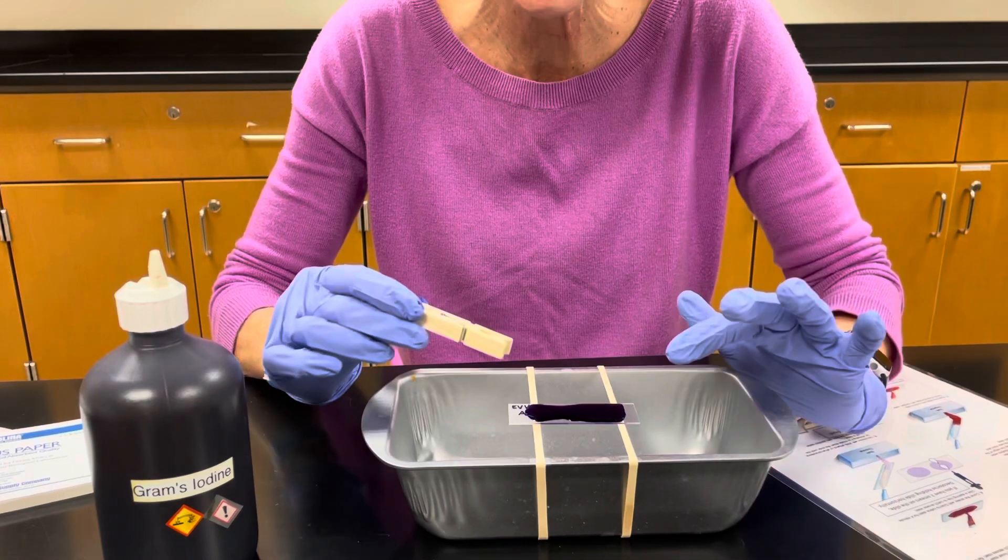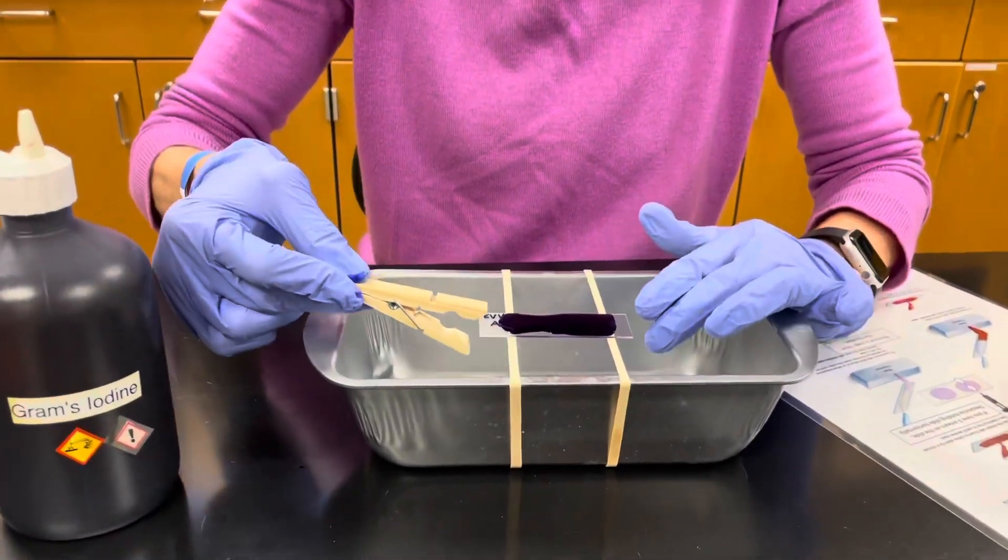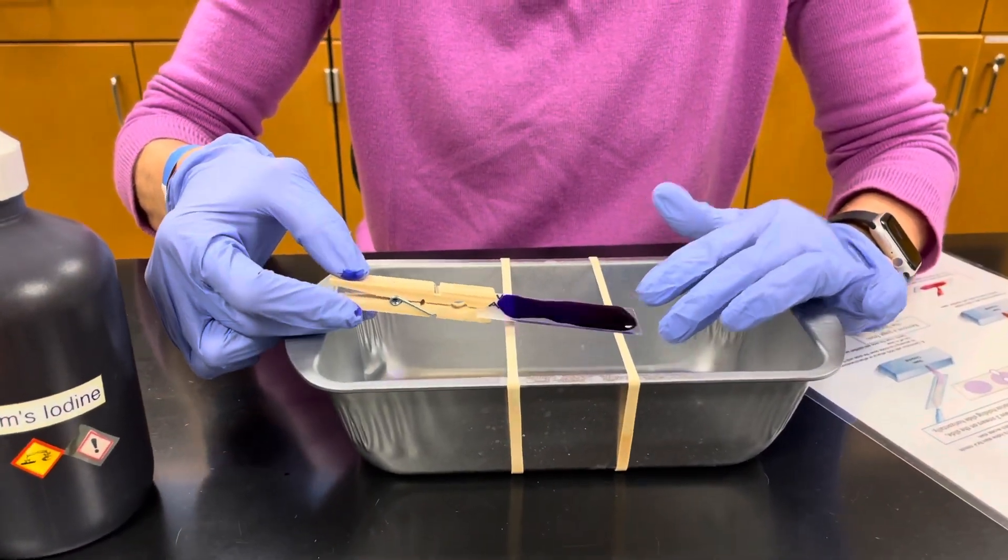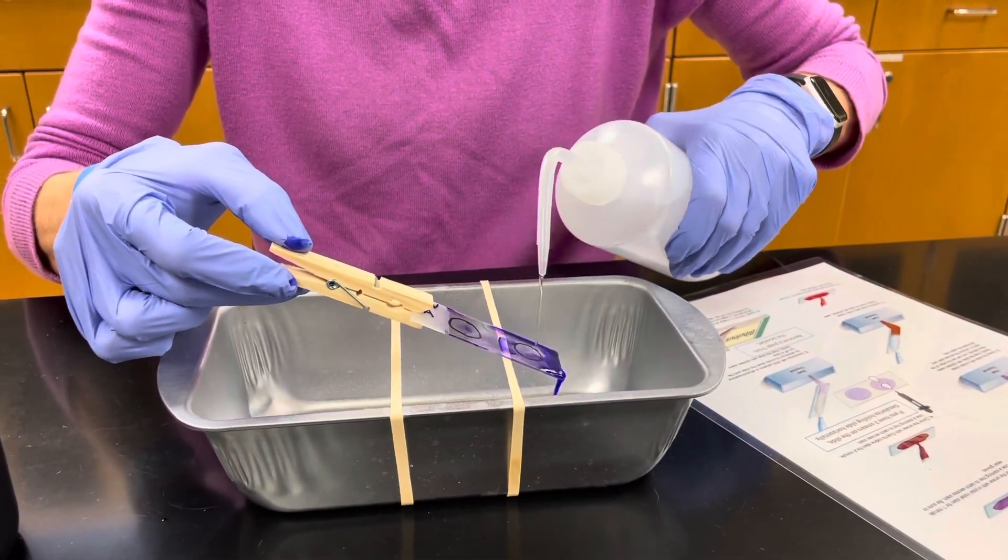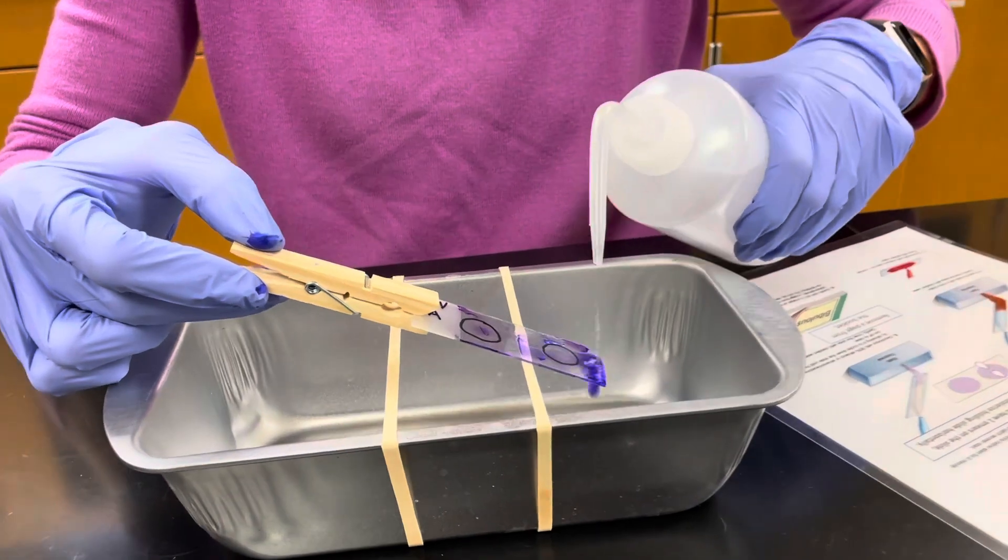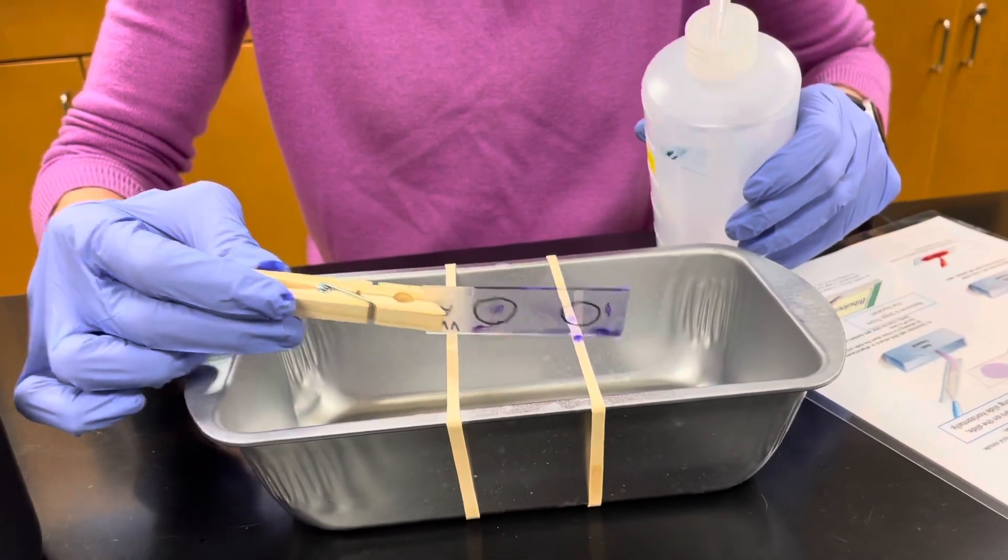Once your stain has sat on your slide for a minute, we're going to gently rinse it with water. You just tap your slide to get off the excess.